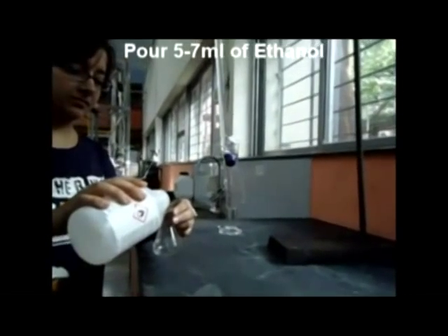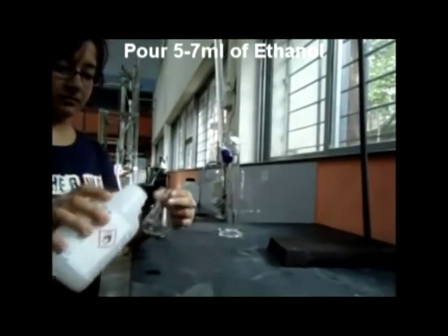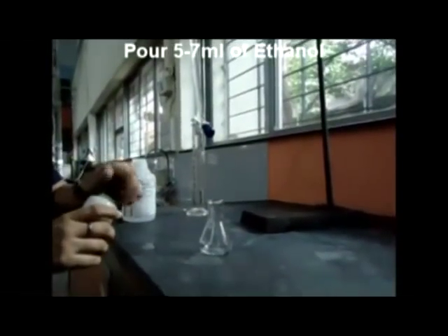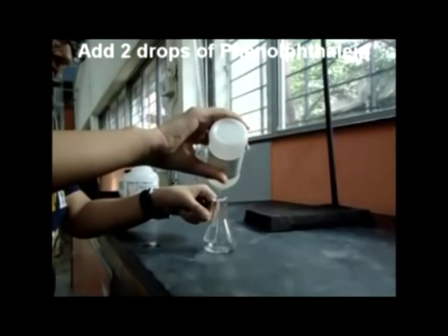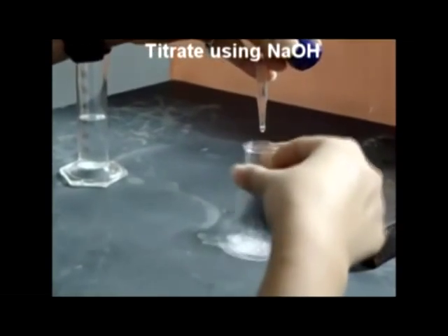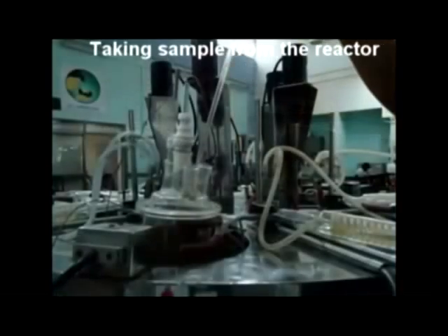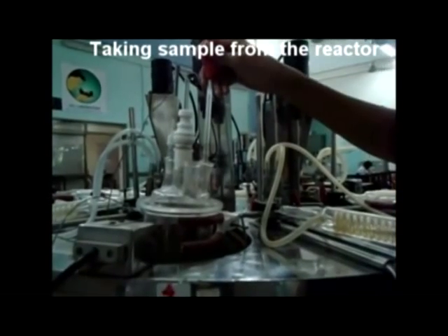Now we need to determine the FFA content in the oil. Here we use ethanol as a solvent to dissolve oil, so take 5–7 ml of ethanol in a conical flask and add 2 drops of phenolphthalein. Titrate using NaOH; a light pink color indicates the titration is complete.